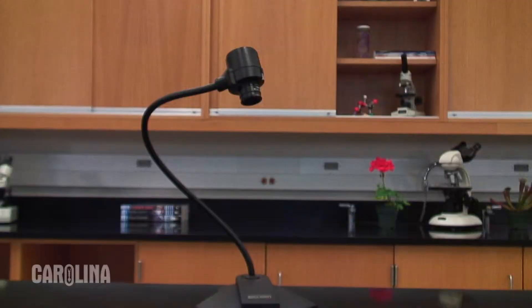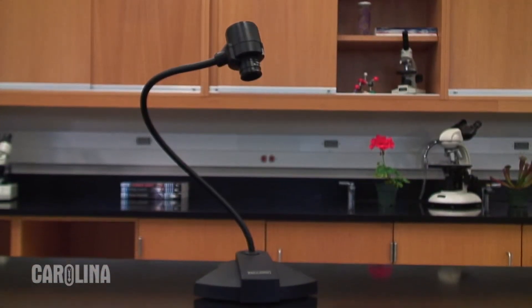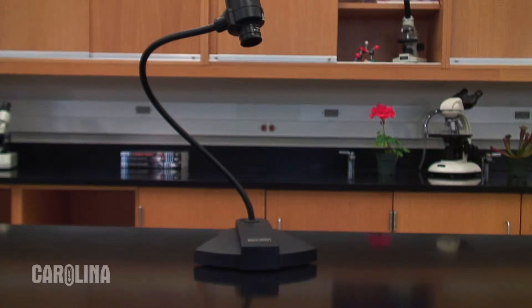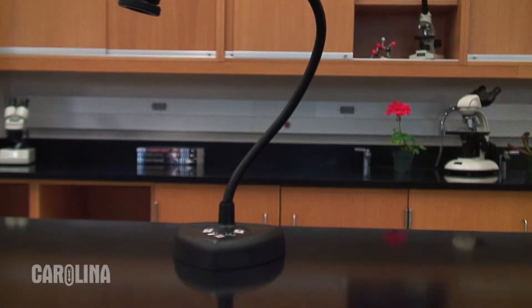You'll easily be able to share still images, slides, and videos with the entire class using a television, computer, or LCD projector. I'm going to quickly take you through the main features of three of our most popular micro video cameras: the StudentCam, TeachCam, and the VideoFlex 7600.